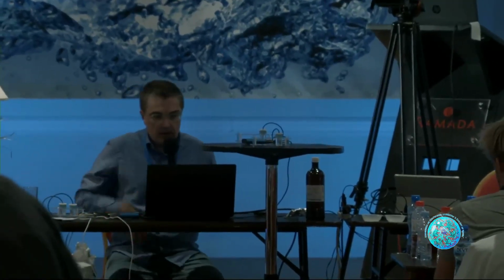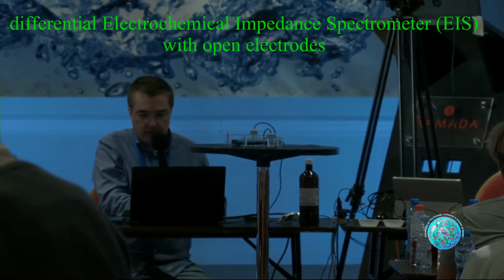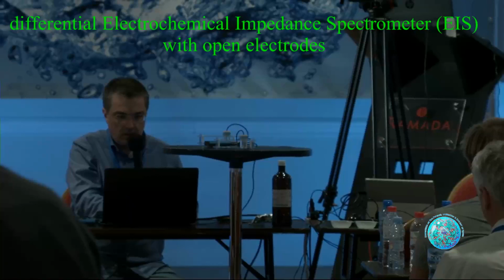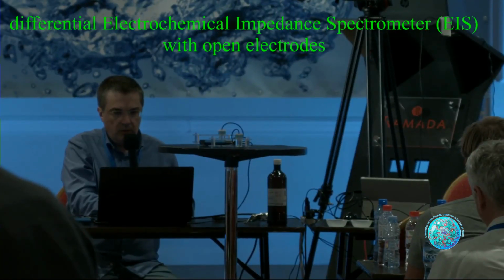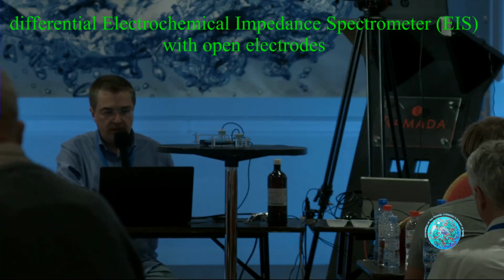Okay. Then here, this is a phytosensor, close it, down, down, down. Okay, I connect it to this device now. And what I will do, we will perform measurement in time at a fixed frequency of 450 hertz.